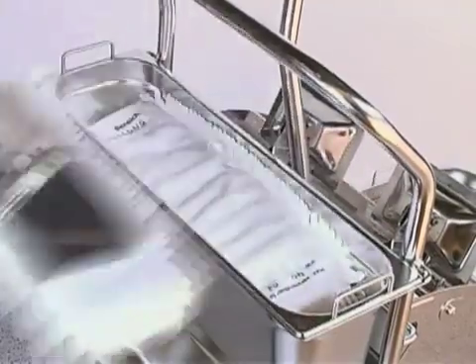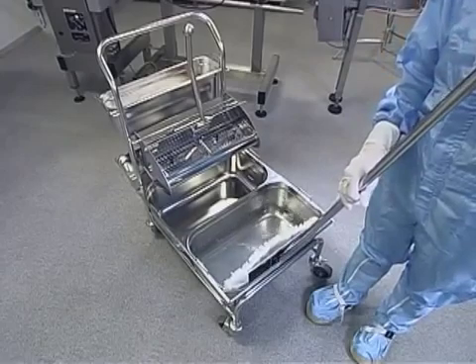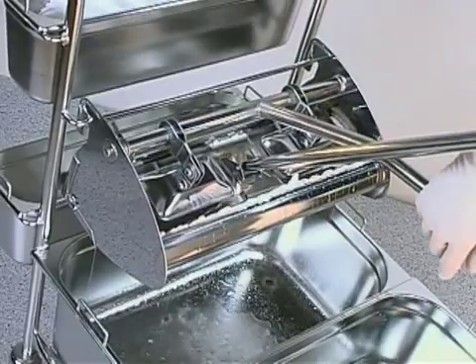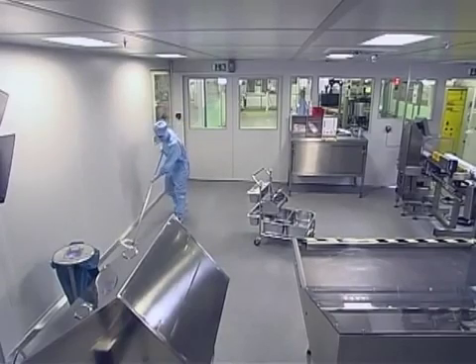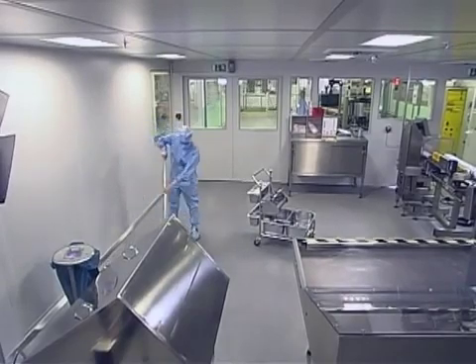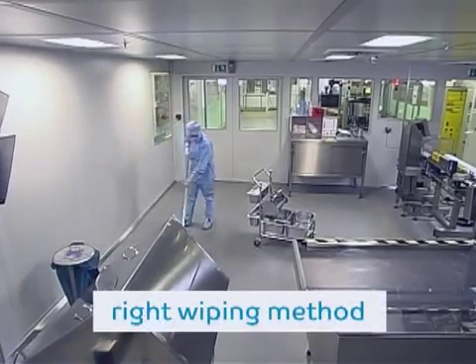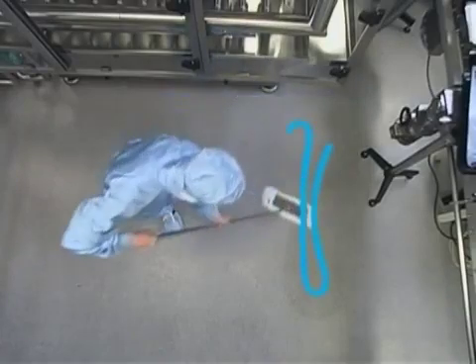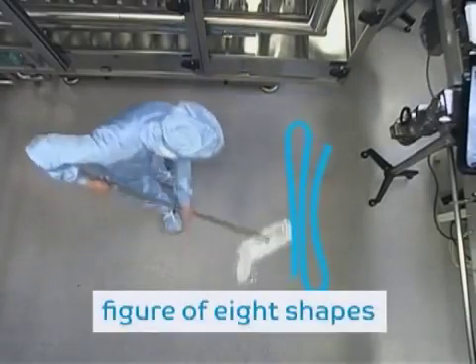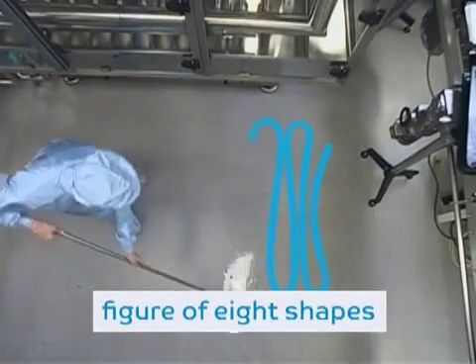Soak the mop with in-use solution in the front bucket and squeeze the mop out using the mop wringer. Now you can start wiping, not randomly, but according to a very special technique exclusively developed for clean rooms. All surfaces such as floors or walls are cleaned with the so-called figures of 8 method. For this purpose, move the mop in 8-shaped loops over the floor while moving backwards.